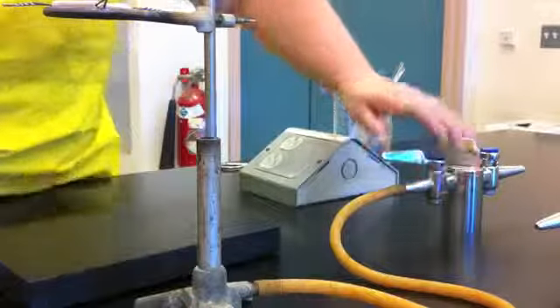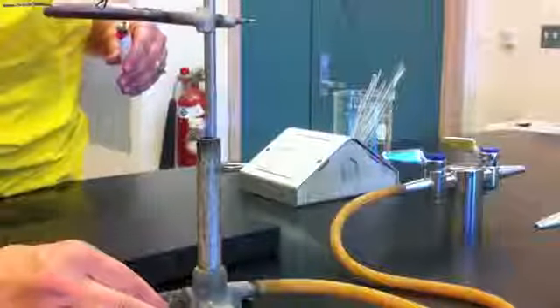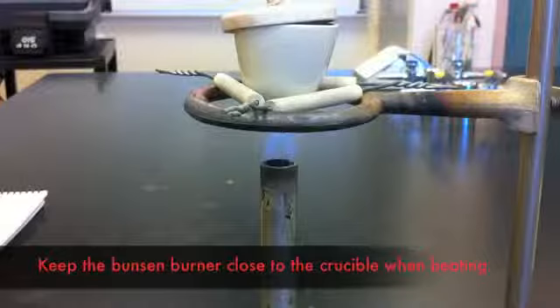Turn on the gas flow and then bring a light, match, or lighter towards the end of the Bunsen burner and it should ignite. In order for this reaction to proceed properly, you need to make sure that the Bunsen burner is close enough to the crucible to heat it well.